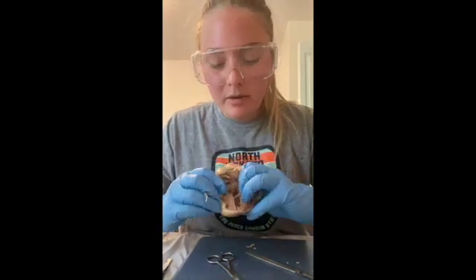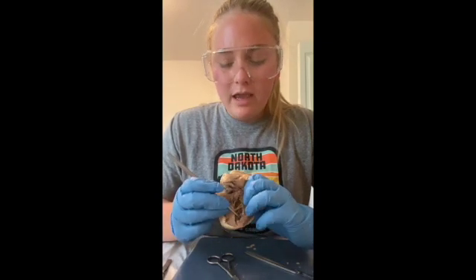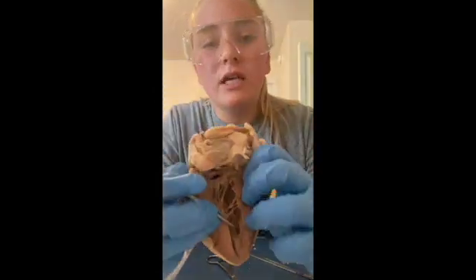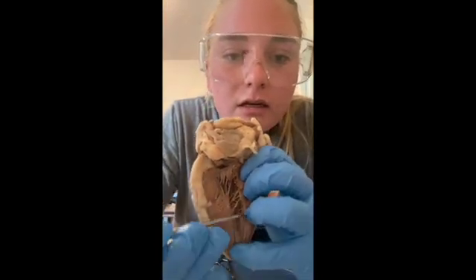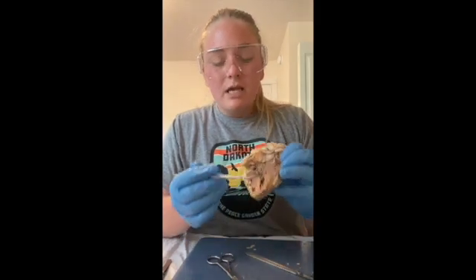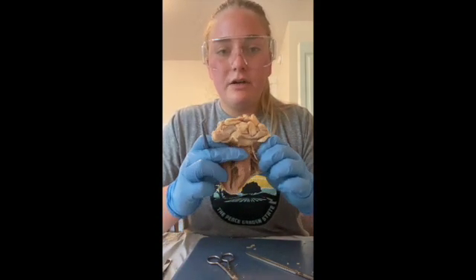And then next we're going to talk about, hopefully I don't say this wrong, trabeculae carneae. Those are these little tissue bands that are attached to the inner walls of the ventricles. I don't know if you can see them down there. So those are those. And then we have the ventricular septum. Excuse me. This thick wall of muscle separates the ventricles. So that is this thing right here.